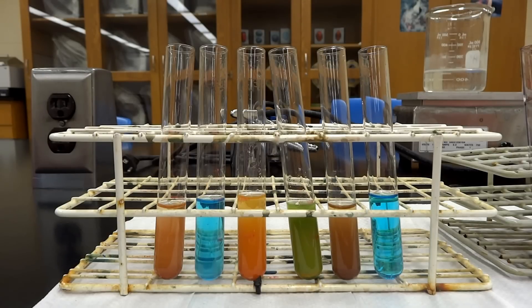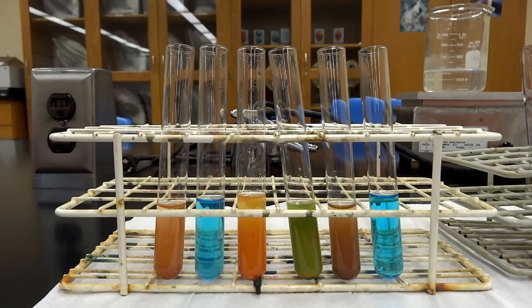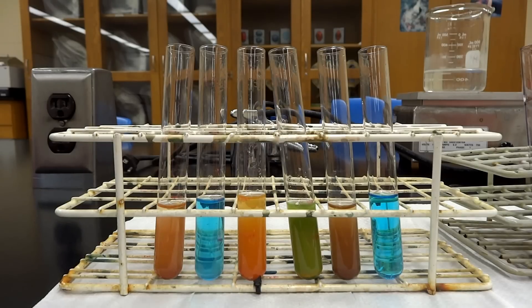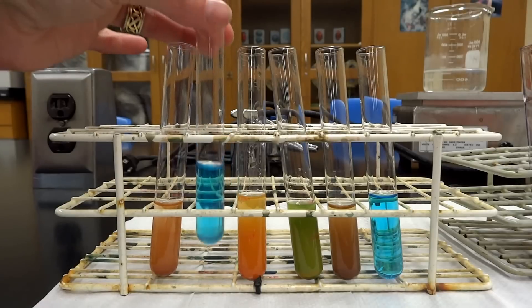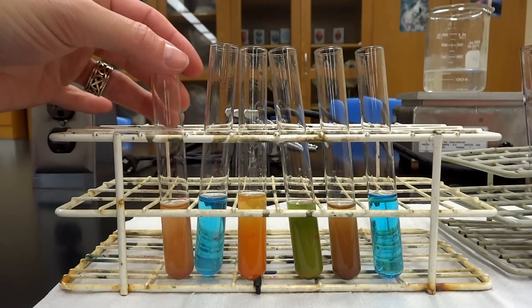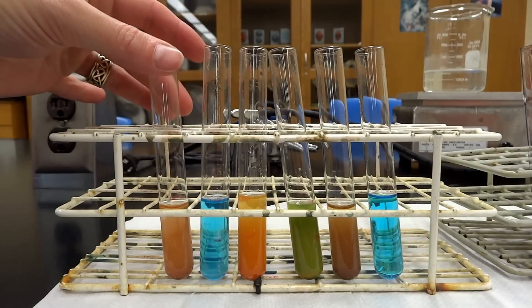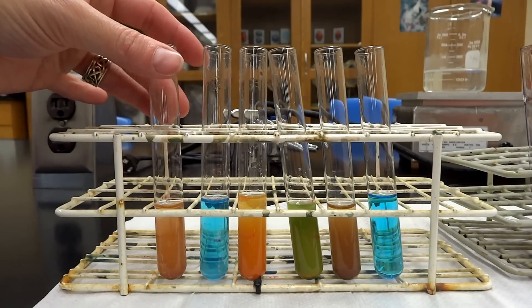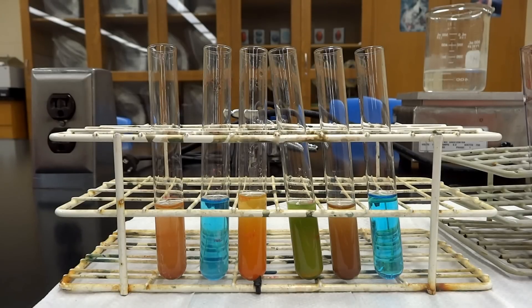For every single solution in this lab, you're going to have a positive control and a negative control — that's going to be test tube number one and test tube number two. A positive control is going to have the substance that we're looking for, so in the case of our Benedict's reactions, we are going to have a reducing sugar solution. It literally says 'reducing sugar solution' and it is a positive control.